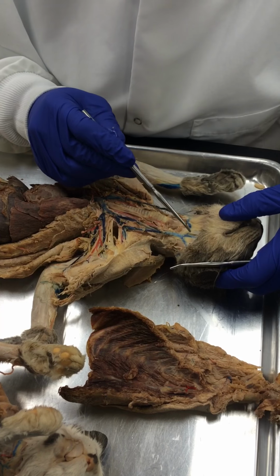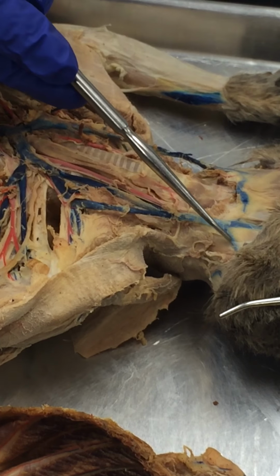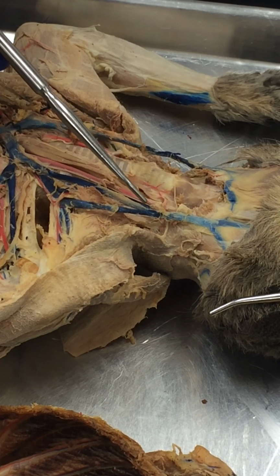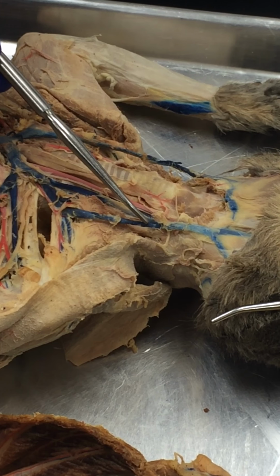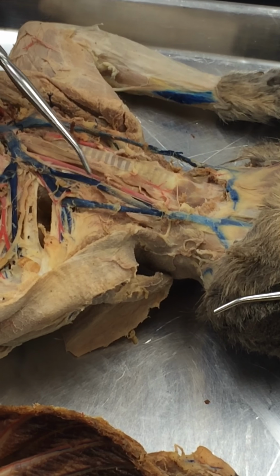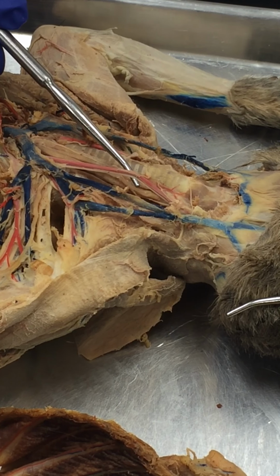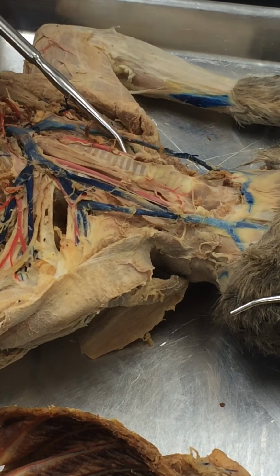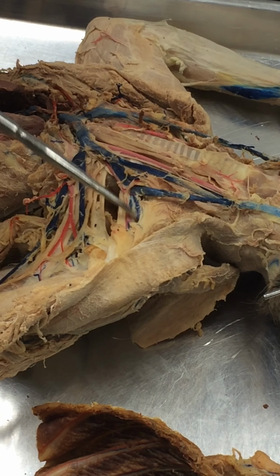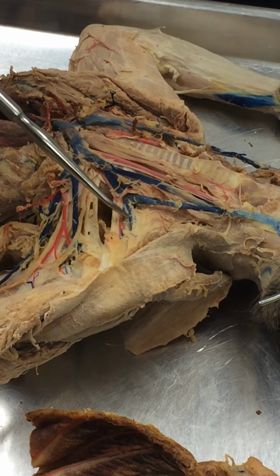Okay, so this is anterior facial vein, posterior facial vein, transverse jugular vein, external jugular vein, internal jugular vein, common carotid artery. Common carotid artery. Again, you don't have to say left or right. And here is the one that I said goes to the trapezius muscle and so forth.